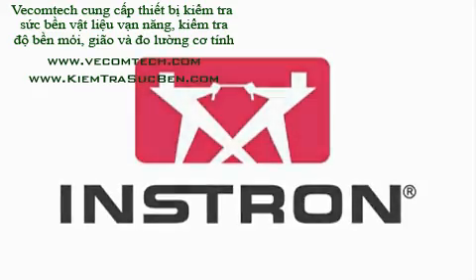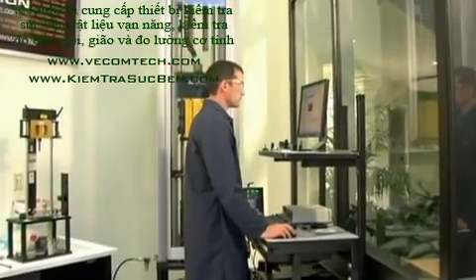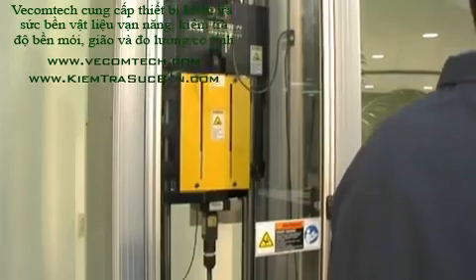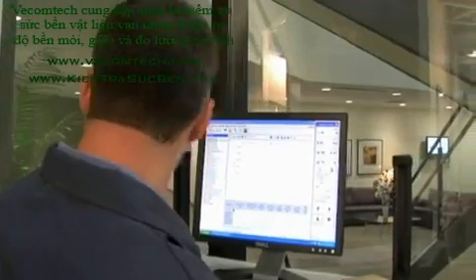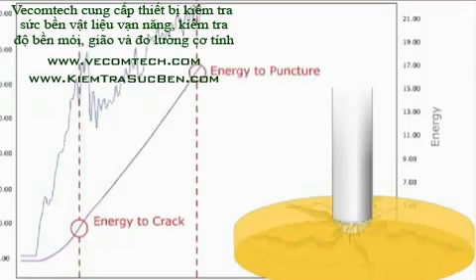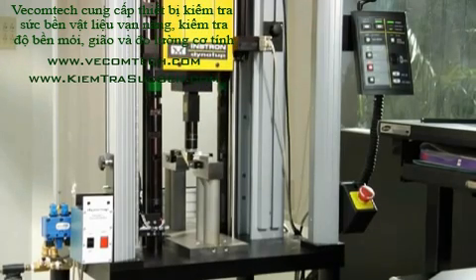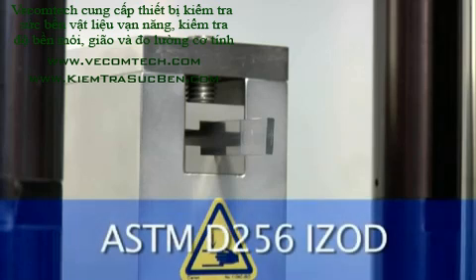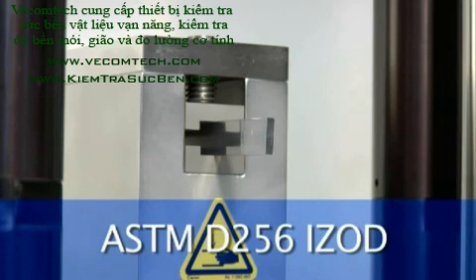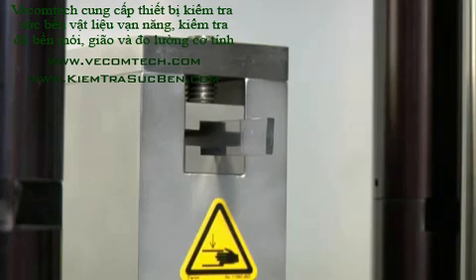Impact resistance is one of the most important properties for a designer to incorporate and one of the most difficult to quantify. Instrumented impact tests record the entire impact event so that the full impact force versus time profile can be analyzed. In this particular ASTM D256 test, we're using a specimen of specific geometry.